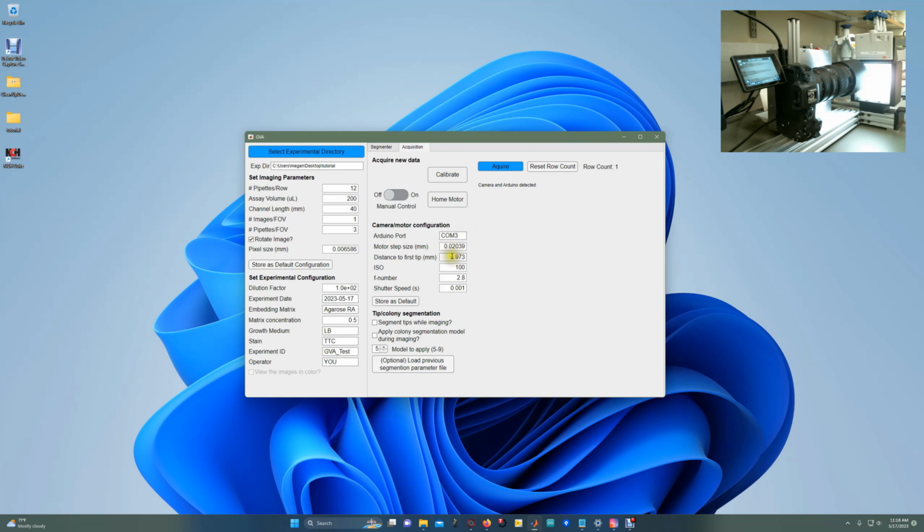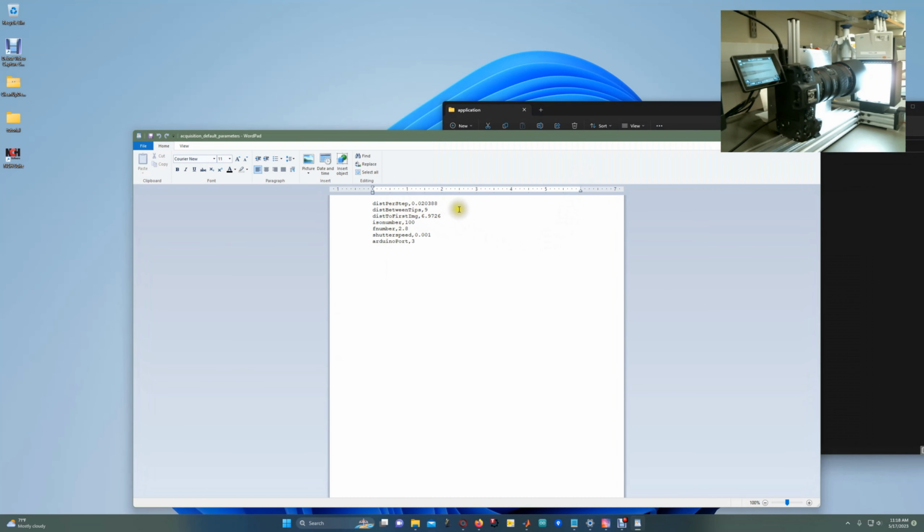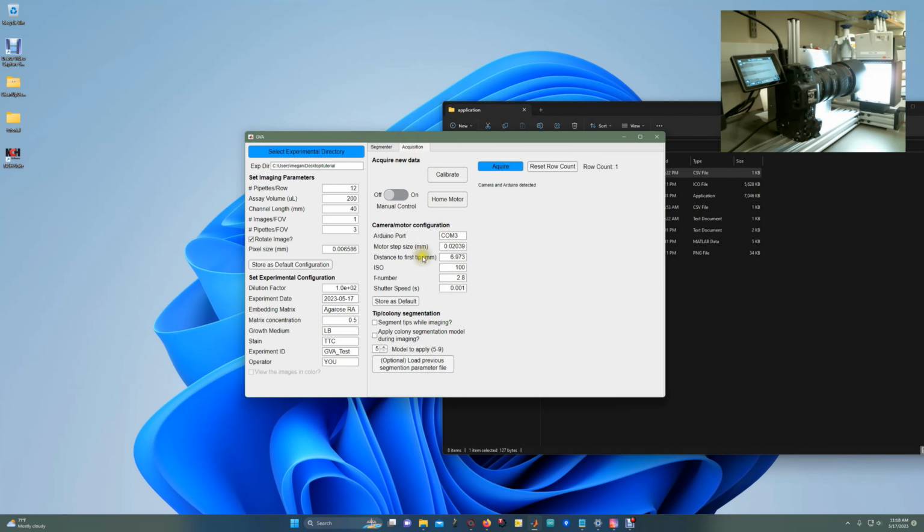The motor step size and distance to the first tip are going to be calibrated, and then these are camera settings. So you can increase the shutter speed or decrease the shutter speed if you want more light. F number deals with the focal depth, and the ISO is basically the gain. If you change these parameters, you can store as default, and similarly to the imaging parameters, the shipped application comes with acquisition default parameters in a CSV file, which when altered here will now load in every time the software is opened. And then finally is the option to try and segment the pipette tips while imaging and apply colony segmentation models. These options will be discussed when we talk about the segmenter tab.